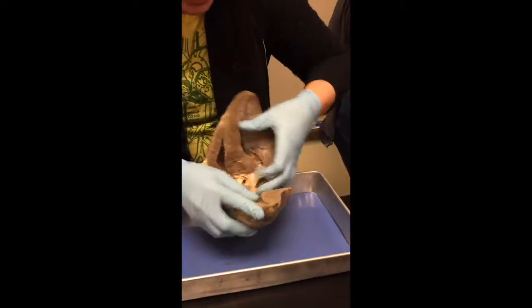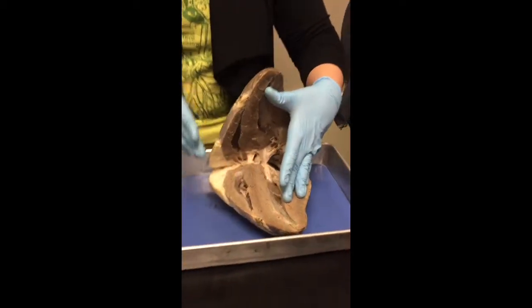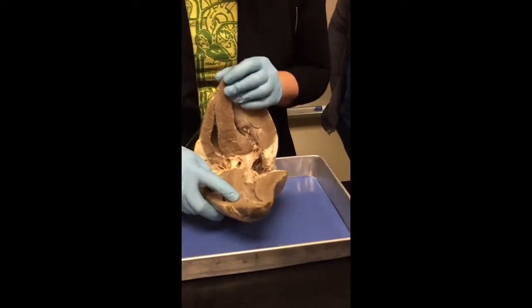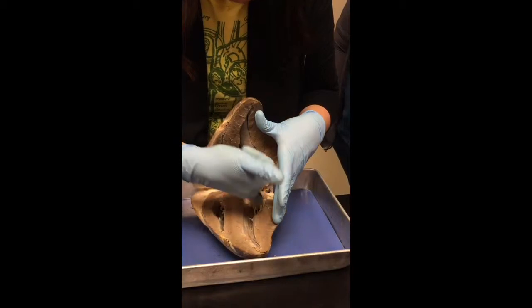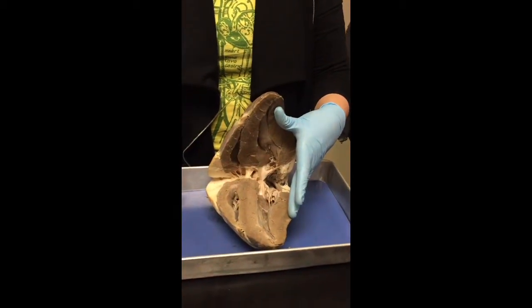So actually on this heart, the right atrium is all the way up in here. You can't really see it, but you can definitely see the right atrium on the models and maybe the other cow hearts, okay? But a good way to tell atria and ventricles, again, ventricles have a V shape to them, and you're going to see the flaps, and whatever is above the flap is going to be the atria, right?